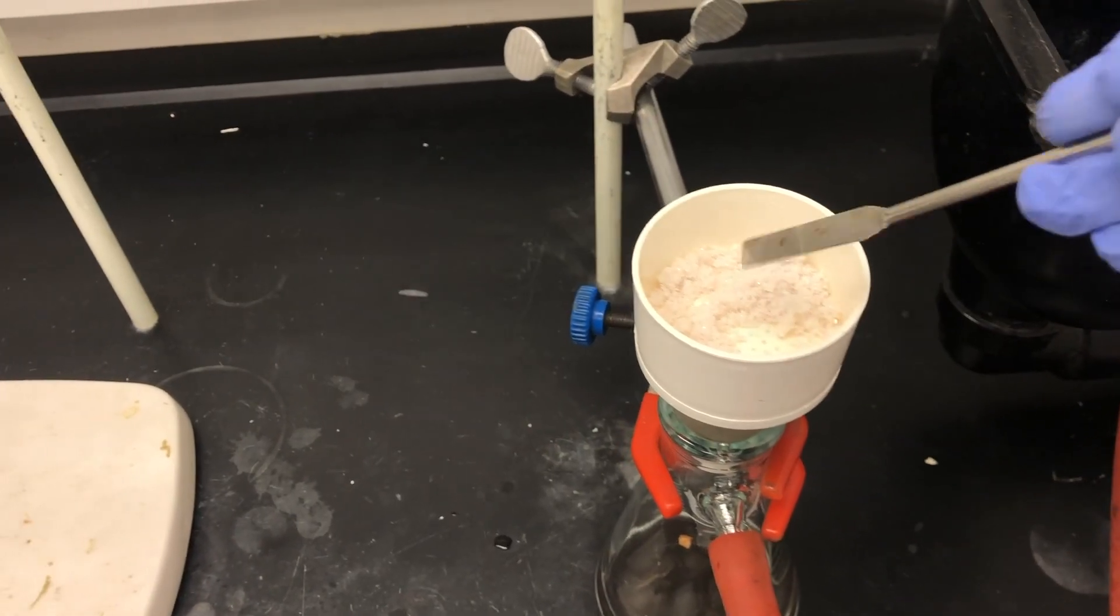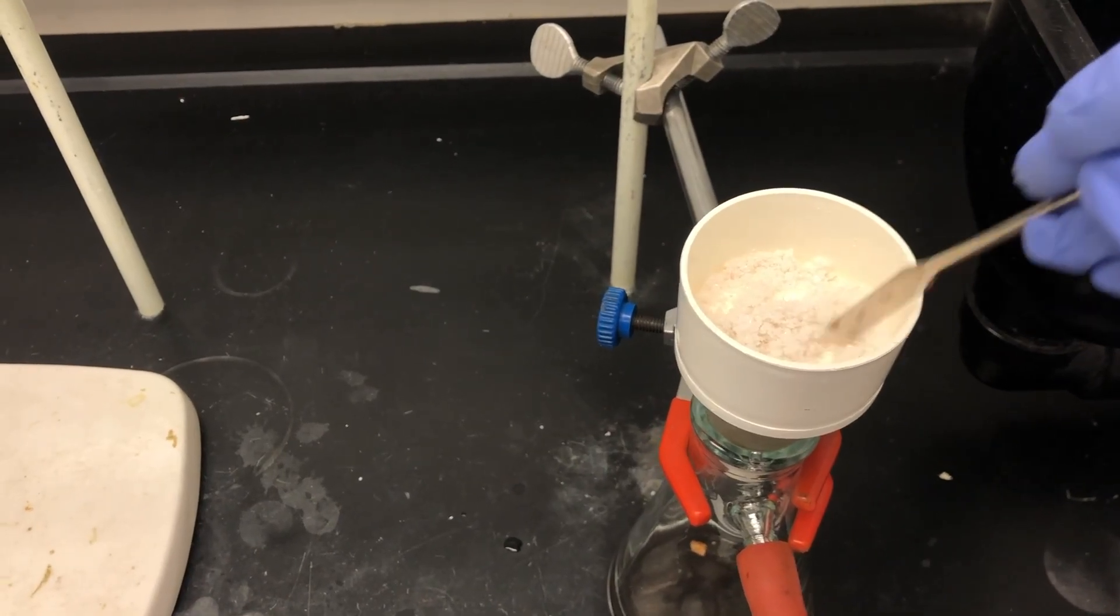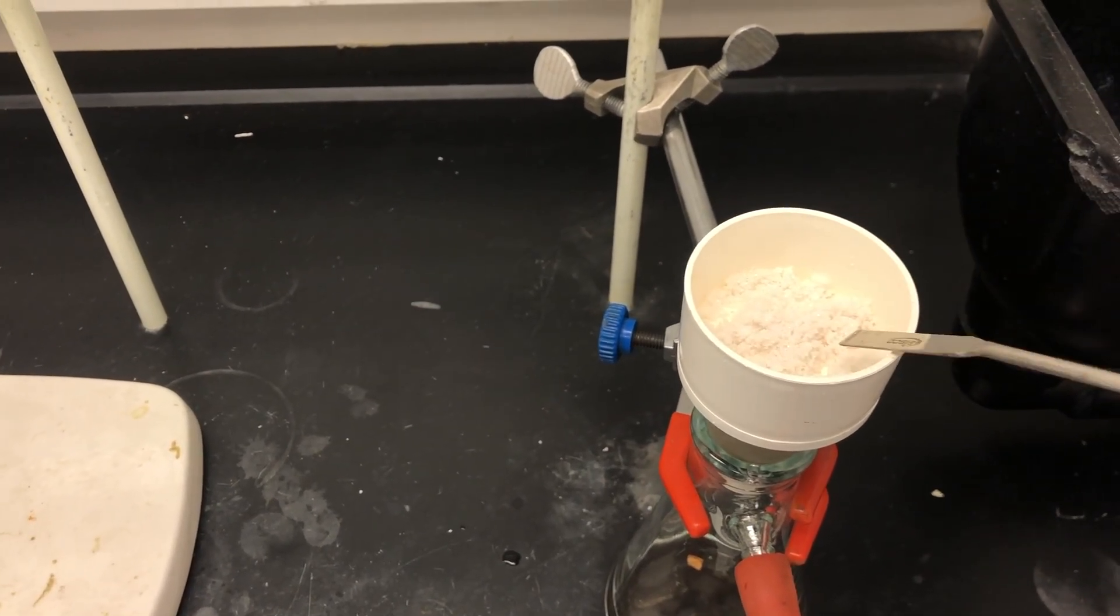We're allowing the crude product to air dry under vacuum, and then we'll measure the weight of the crude product.